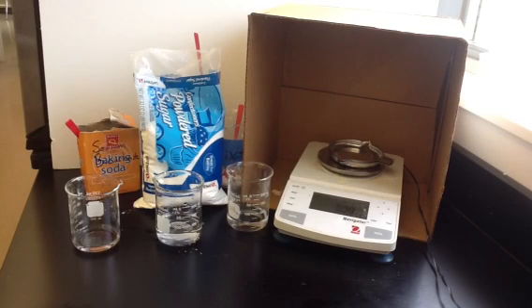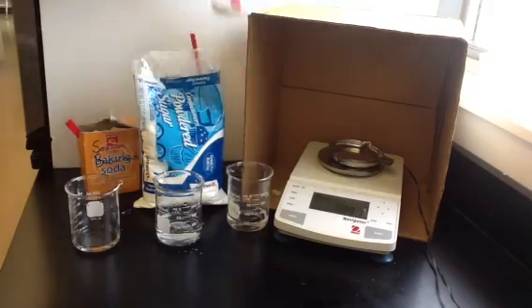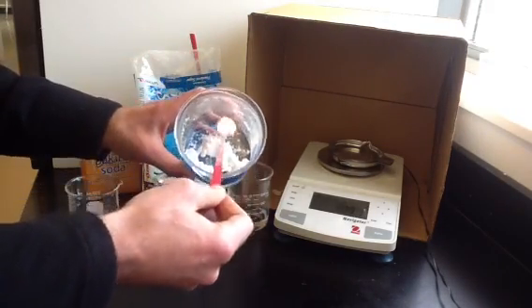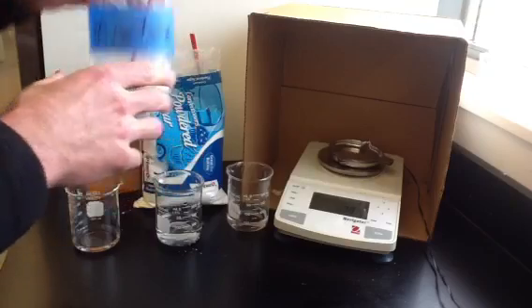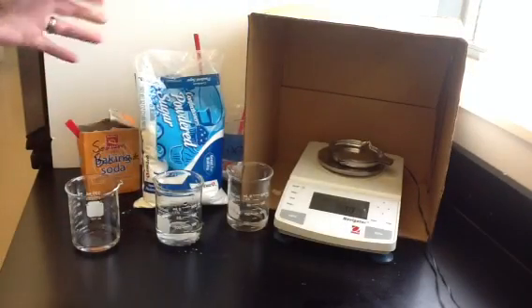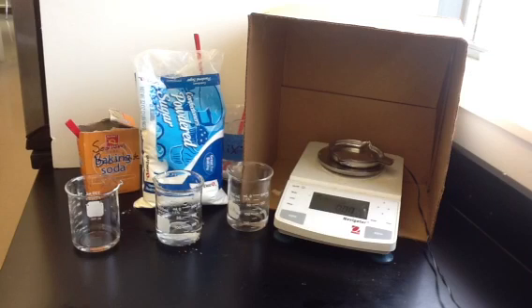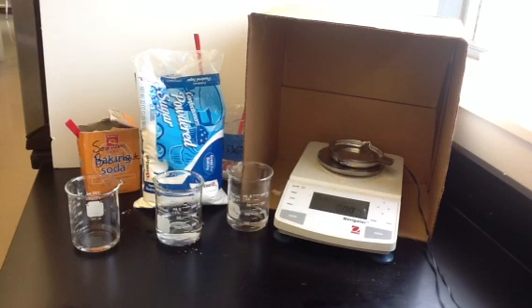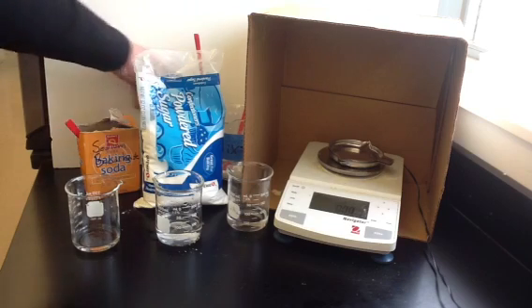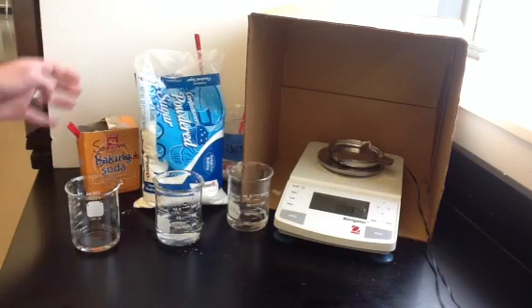In our lab today we're going to be figuring out the percentage of sodium bicarbonate in a mixture. Our mixture is a mixture of sodium bicarbonate, which is also baking soda, and sucrose or powdered sugar. Both substances look very similar — they're both white powders — so it's hard to tell how much of each one there is. We're going to do a reaction, take some measurements, and do stoichiometry to figure out what percentage of this mixture is sodium bicarbonate and what percentage is powdered sugar.